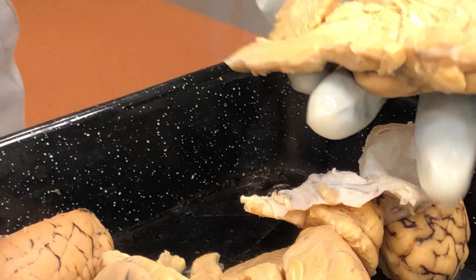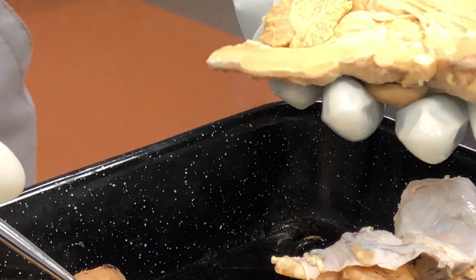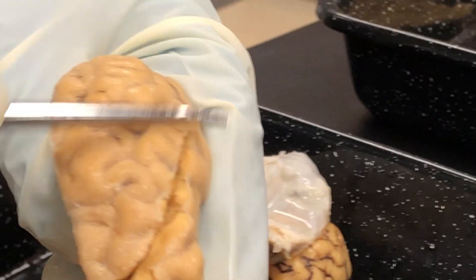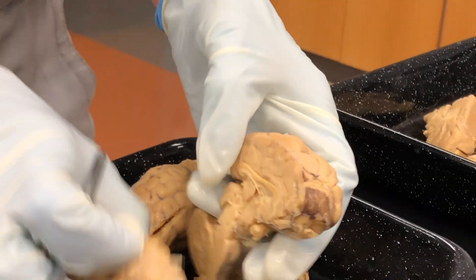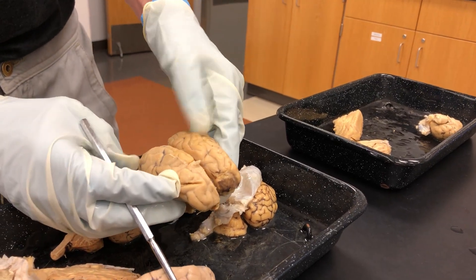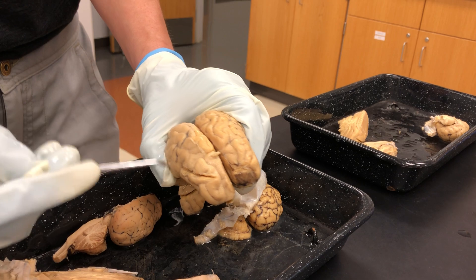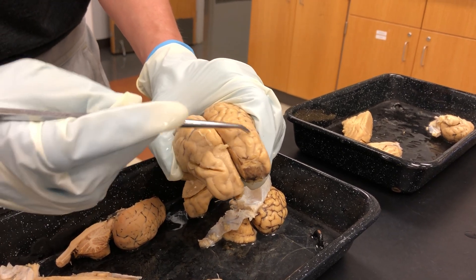The next structure to identify is the cerebrum. This whole part is the cerebrum — this is the left hemisphere. If you take two of these together, you get the entire cerebrum, but remember it's divided into left and right hemispheres. The cerebrum is the largest part of the brain, and it's the part covered in sulci and gyri.